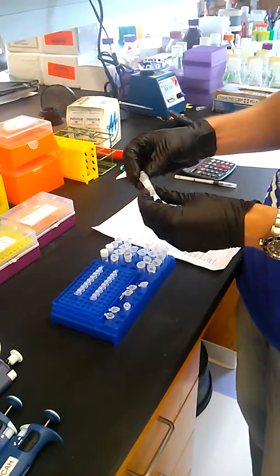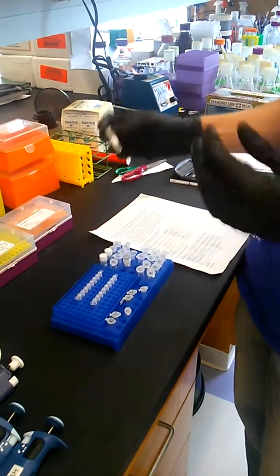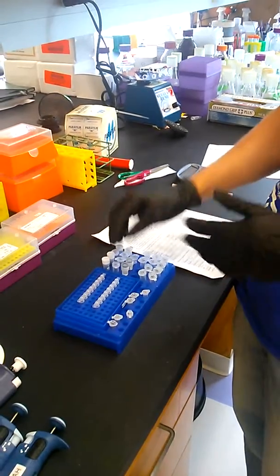You also need a buffer for whatever polymerase you're using. So there's different buffers for different polymerases. You want to make sure you have the right one.